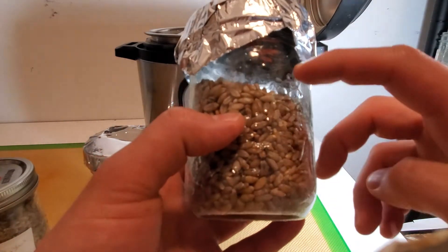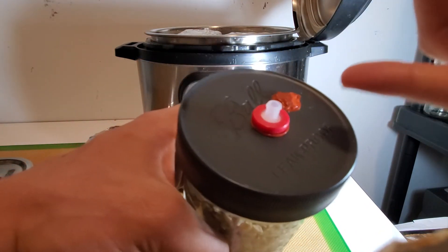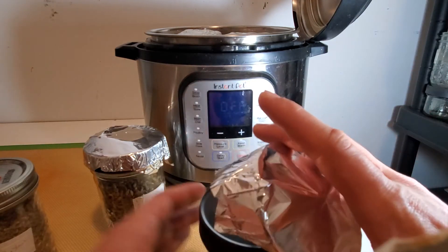After that I filled it with the grain, placed the modified lid on top — one with an injection port and one with a breathing port — then covered it with tinfoil.